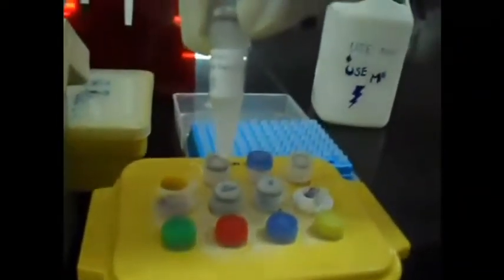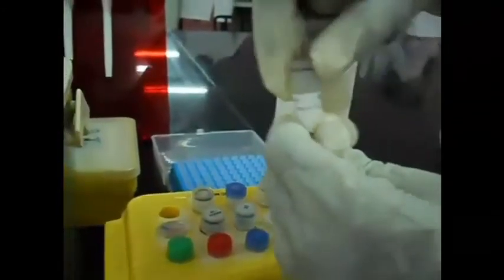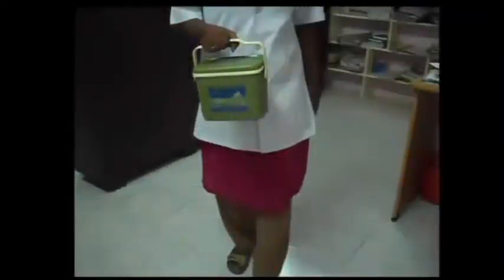Add Taq polymerase at the end of the cocktail mix to prevent the start of the reaction. Make sure there is no exogenous contamination of DNA. The concentration of DNA used must be between 50 and 100 nanogram per microliter. Use new tips for loading each sample. Carry the samples to the PCR machine in ice box.